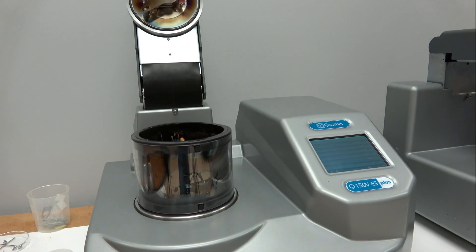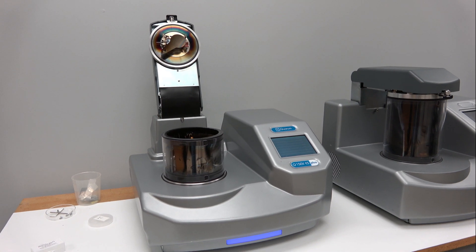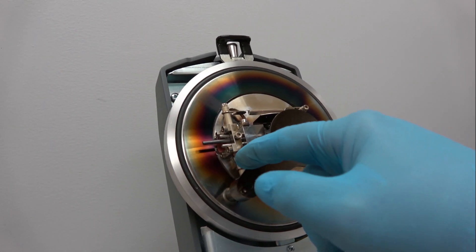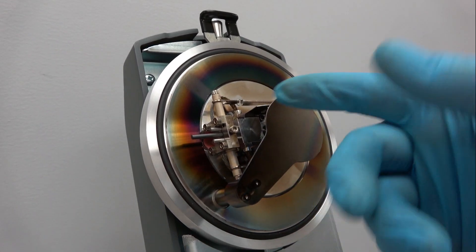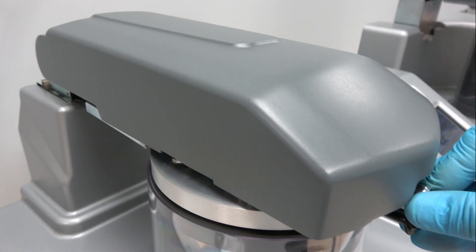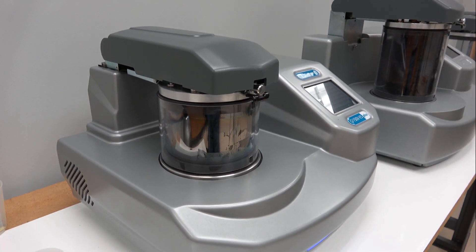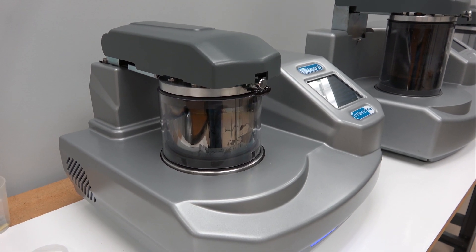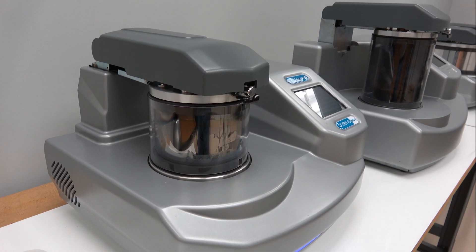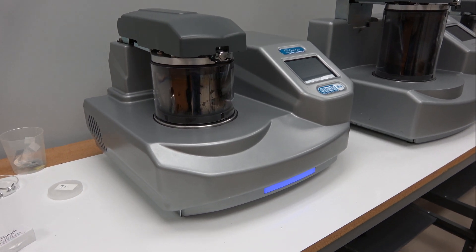That's the complete process. The machine is telling you it's vented fully and is ready for the next operation — either refurbish the evaporator on the machine, though I generally like to take it off the machine to refurbish for the next sample. That's all I have for you today — this is pulsed carbon rod evaporation in the Q150 series. Thank you for your attention.